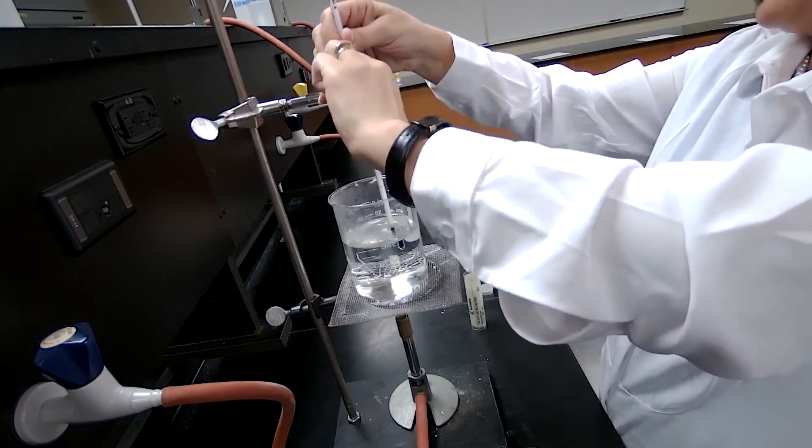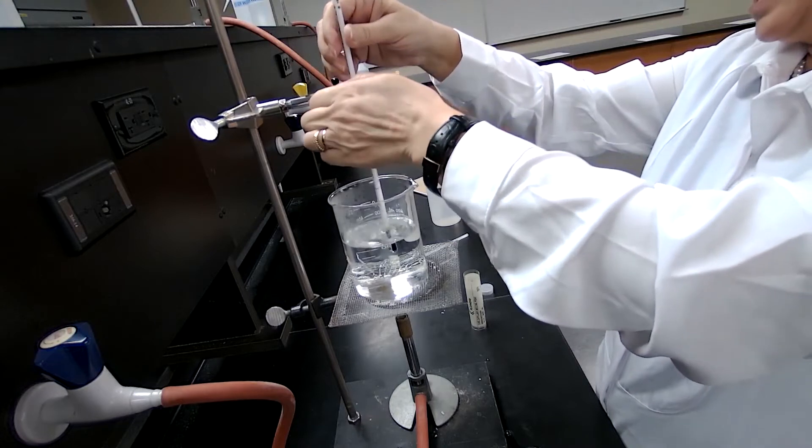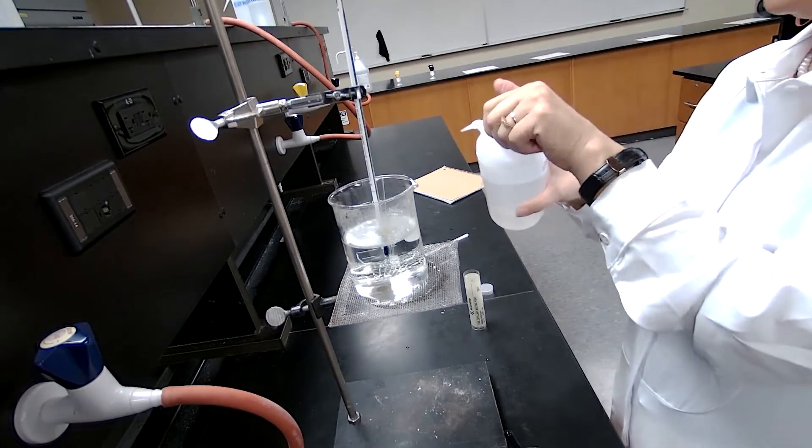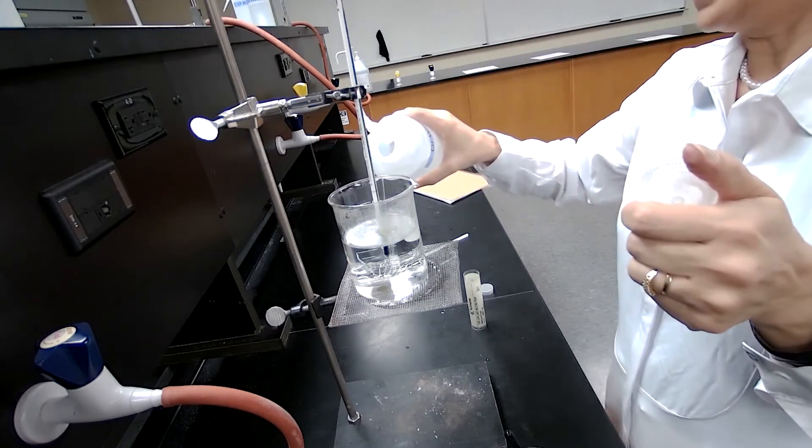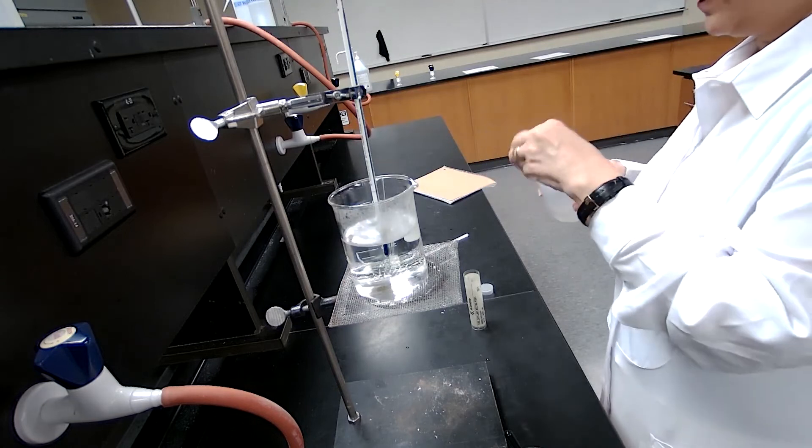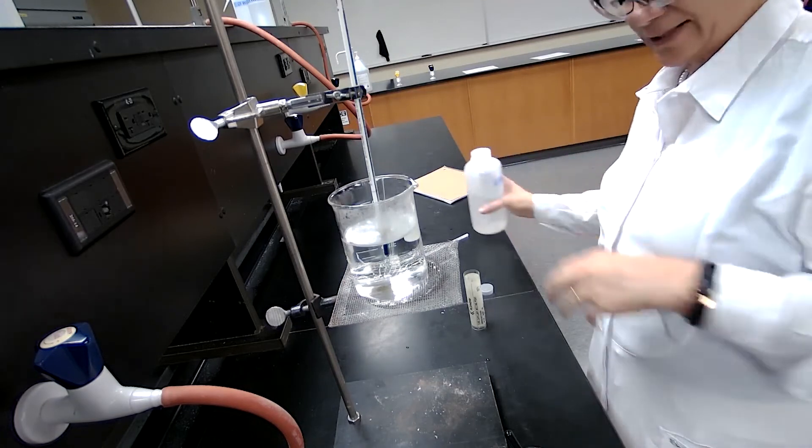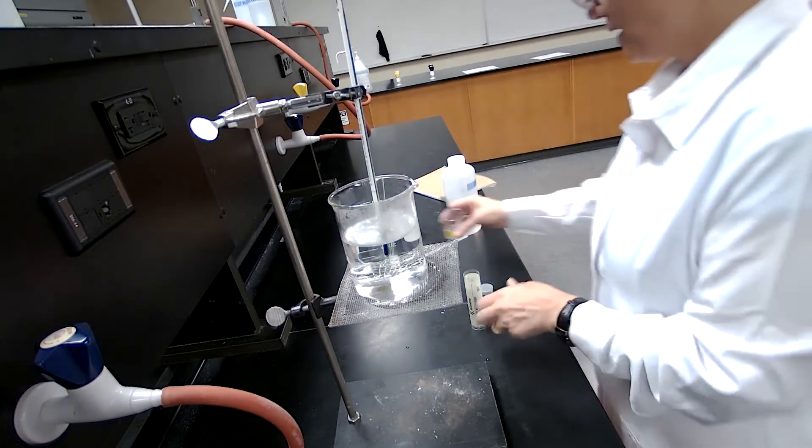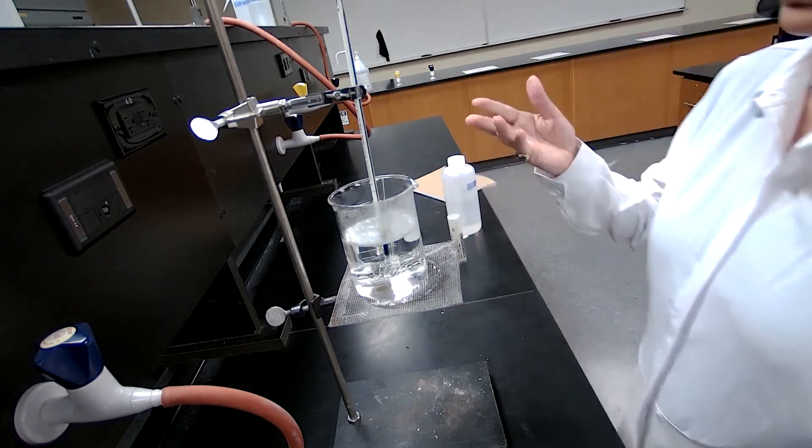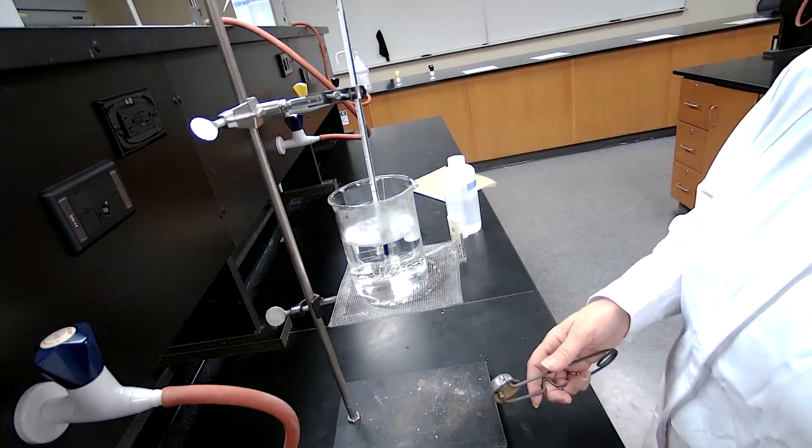inside the water bath to make sure that the liquid is immersed in the water. So I want to make sure that the temperature of the water bath is lower than the boiling point for the sample, otherwise it will start boiling right away.